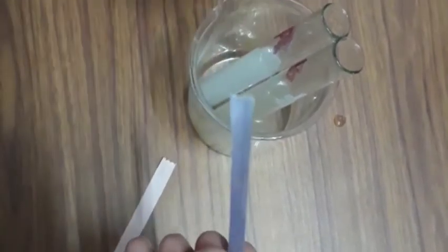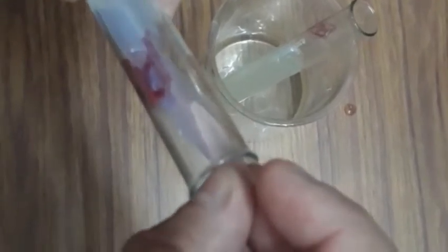First of all I am going to dip this blue litmus paper in test tube A. There is no change in this blue litmus paper. Now I am taking the red litmus paper and going to dip it in test tube A. You can observe that the red litmus paper is changing into blue litmus paper.